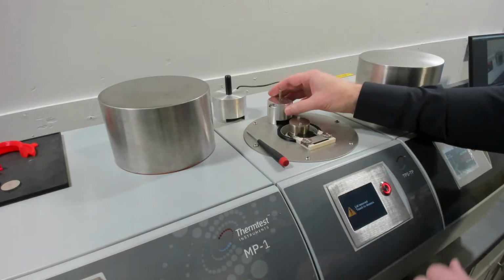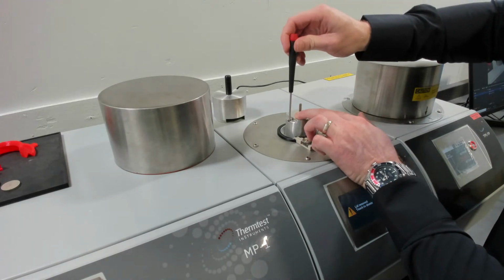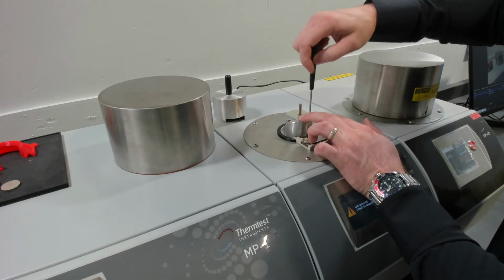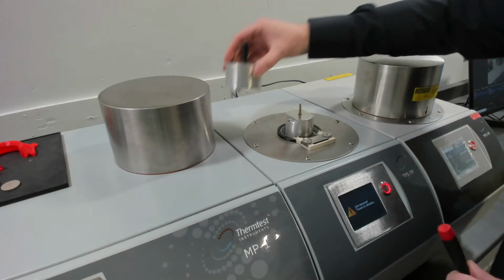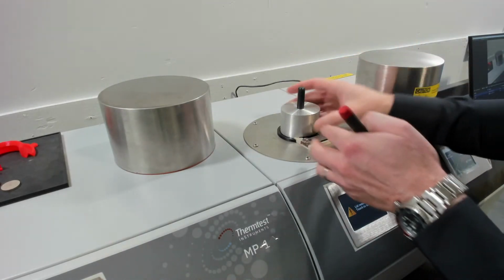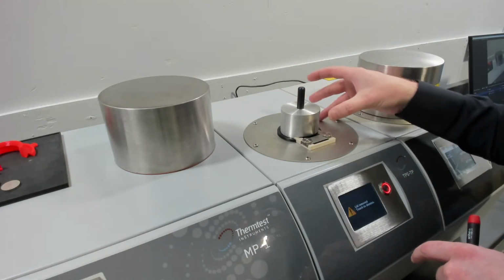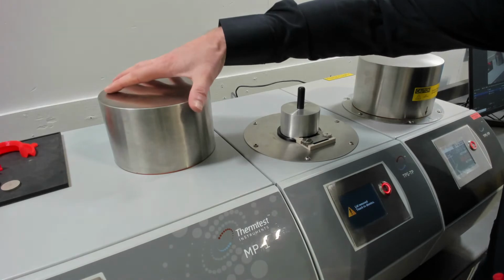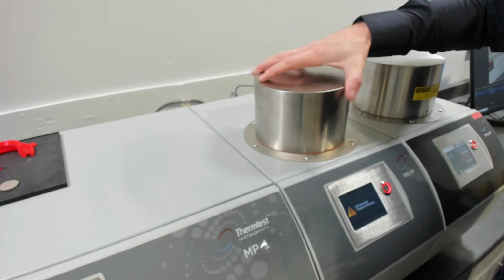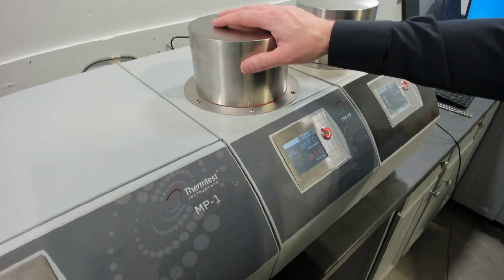And that's the setup. So we'll use the top lid. This closes the heating portion of the temperature platform. It completes the heating step, and then this lid completes the cold. So you have a heated cell inside a cold cell, and that gives you very good control of temperature. And then we put this on. This has a switch inside that's a safety so that you can't burn yourself.